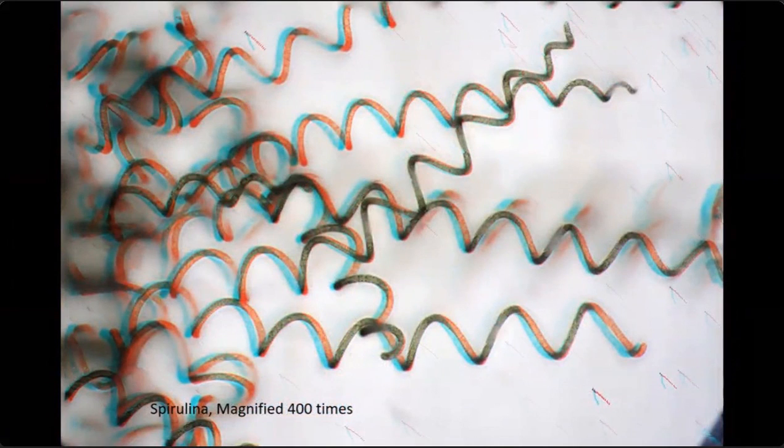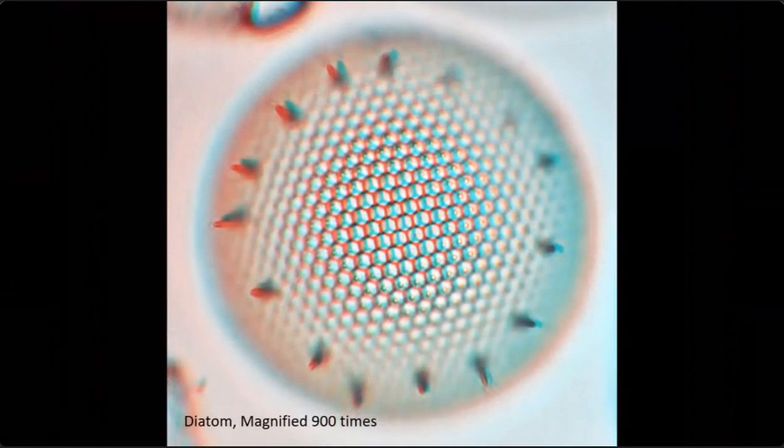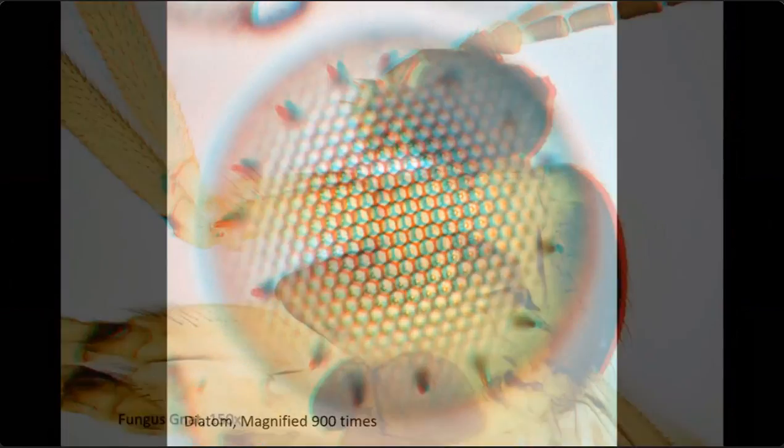There's some spirulina in stereo 3D. This is a radiolaria. I'm going to show you a little later how you can get these kinds of images using our optional 3D illumination system. That's a diatom. This evolved a few 100 million years before Buckminster Fuller, who designed these domes that look similar to that.